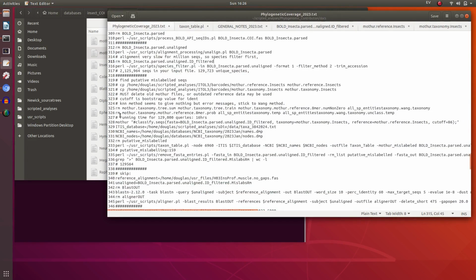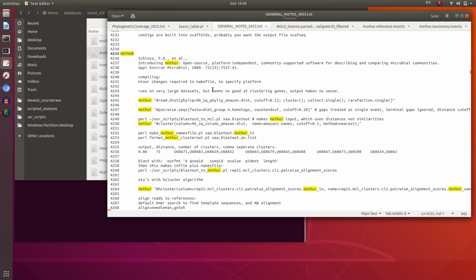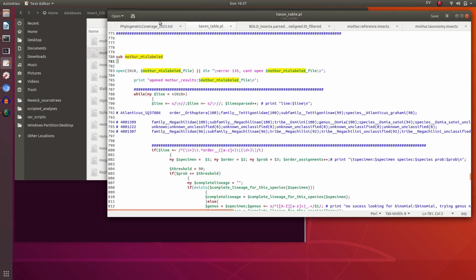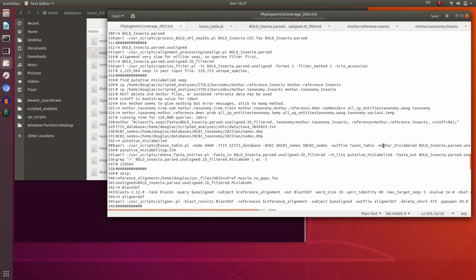Now, we need to have Mothur installed. Installing Mothur shouldn't have too many difficulties. You just need to check the makefile and specify the platform, and that should install no problem. We use a classify command. The algorithm is called the Wang classification algorithm. It is the default for Mothur. And then to infer the mislabeled stuff, we then use a taxon table. So the key argument for this is to take the output from Mothur.